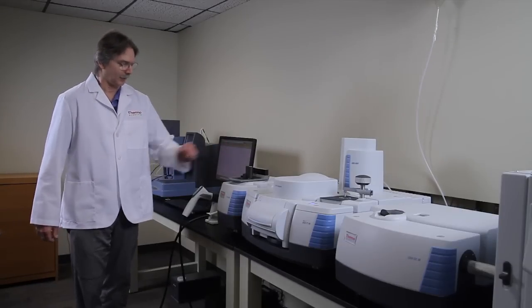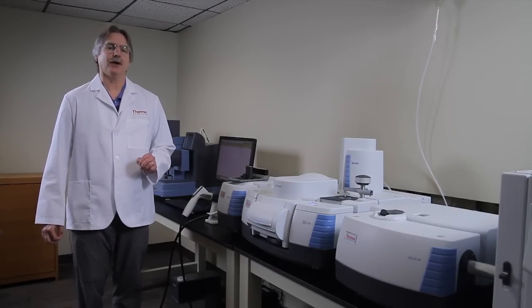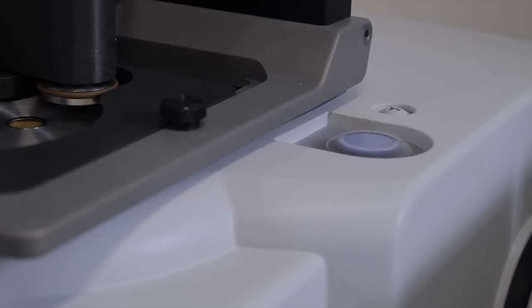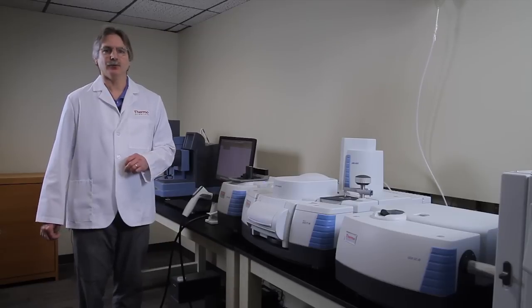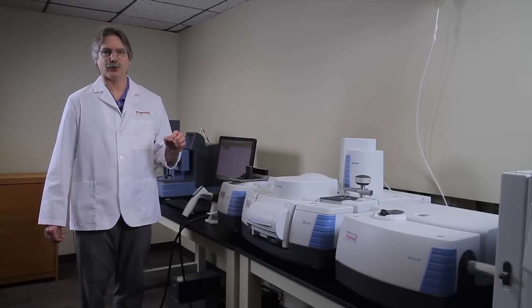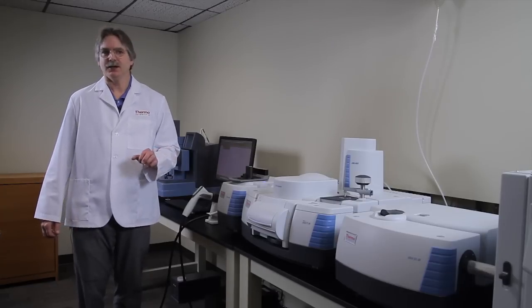First of all, we'll look at the integrating sphere. And one of the things I want to emphasize with the IS-50 is that collecting spectra is as easy as just pushing a button. So I'm going to push the blue button here. The spectrometer will go through its paces where it swaps around different light sources and beam splitters. Eventually, it'll be ready.